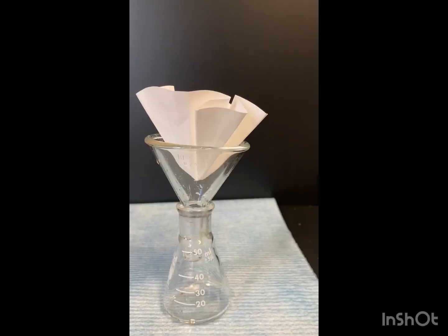Our solution has started to boil, so we're just going to remove it from the hot plate and pour it into our gravity filtration. You're going to do this pretty quick.